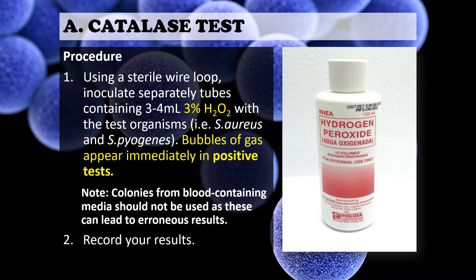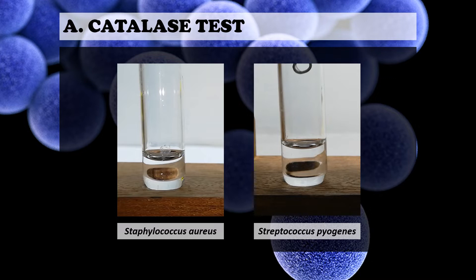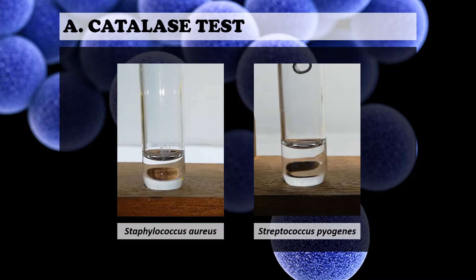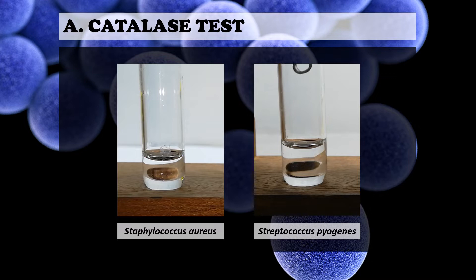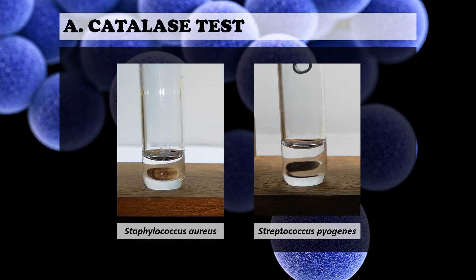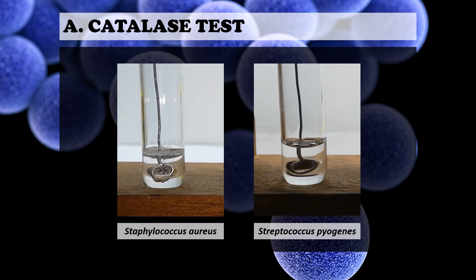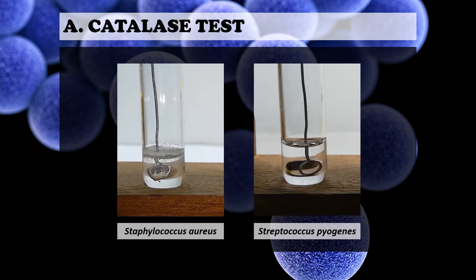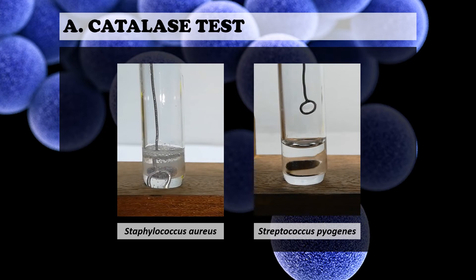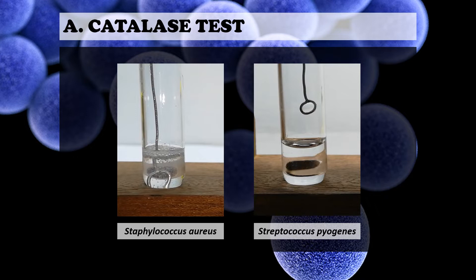After that, record your results. To demonstrate the catalase test, we have here Staphylococcus aureus and Streptococcus pyogenes. These two react differently to the catalase test — one will produce bubbles of gas and one will not react at all. Using your wire loop, insert it into your tubes containing hydrogen peroxide. As you can notice, Staphylococcus aureus produces gas immediately after inserting the wire loop, while Streptococcus pyogenes does not react at all. So Staphylococcus aureus is catalase positive and Streptococcus pyogenes is catalase negative.